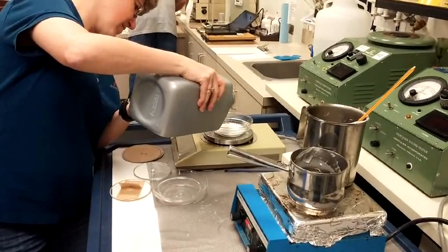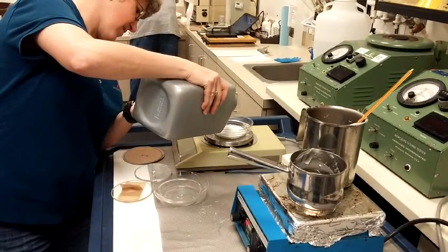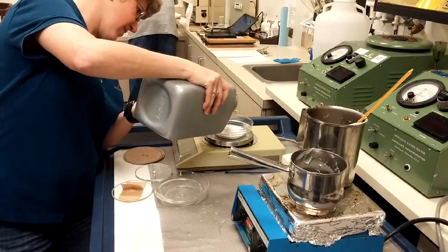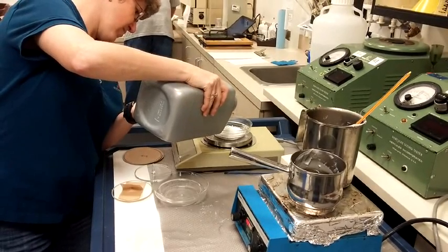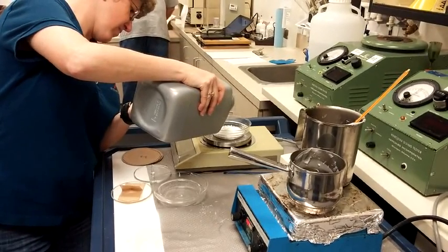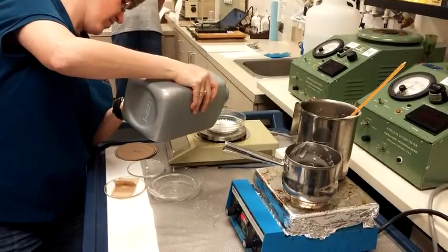WVTR, or water vapor transmission rate, is a measure of the rate at which water vapor in the surrounding atmosphere will pass through a paper product.